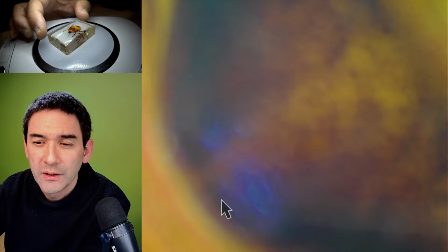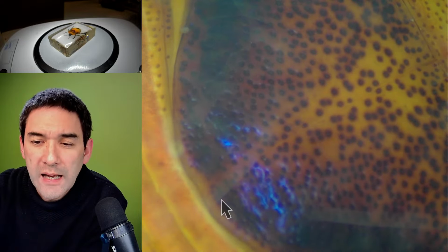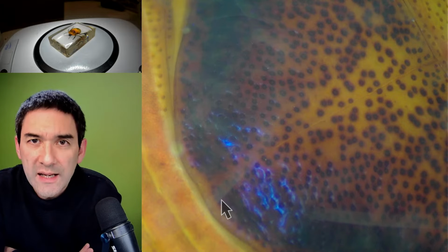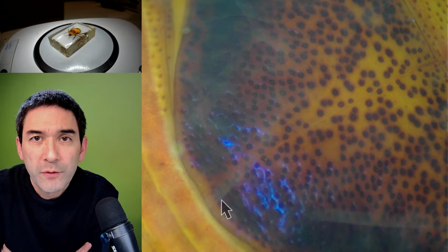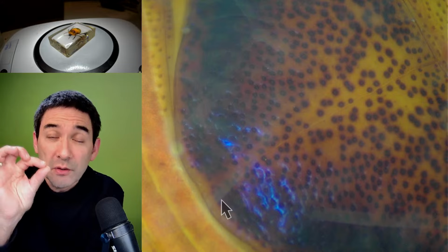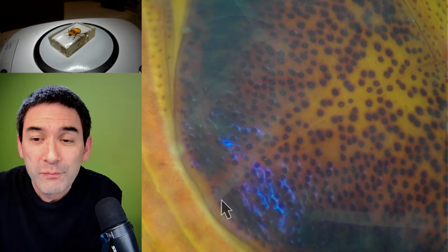Yeah, okay. Yes, if you cast, yes. I also heard about that. If you have a brittle sample, then you can cast it in epoxy. I've heard that some people are doing stone and rock samples this way. They're embedding them first in epoxy resin, and then they're polishing and grinding them down to make them very thin. I've also not done that yet. I think it's a little bit time consuming and requires a lot of patience.